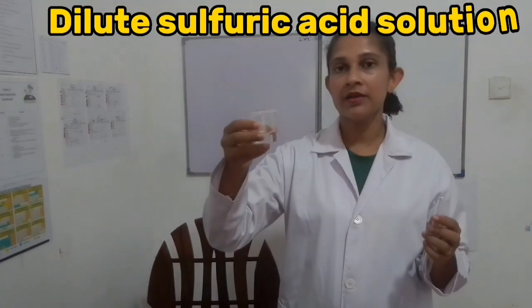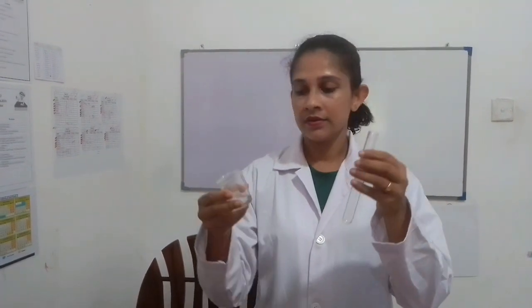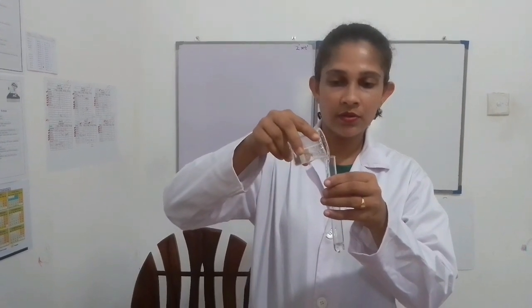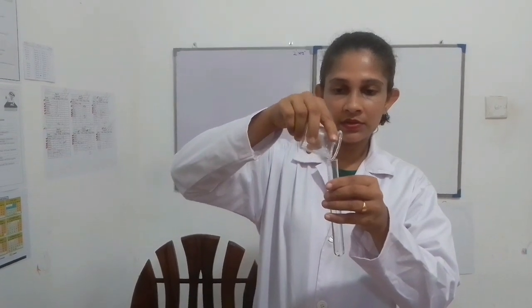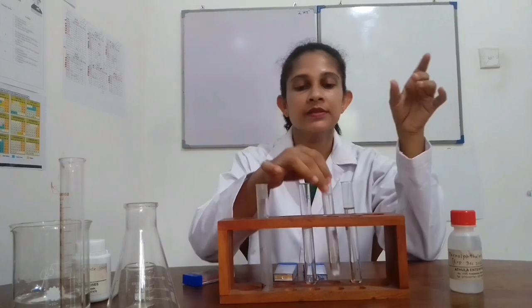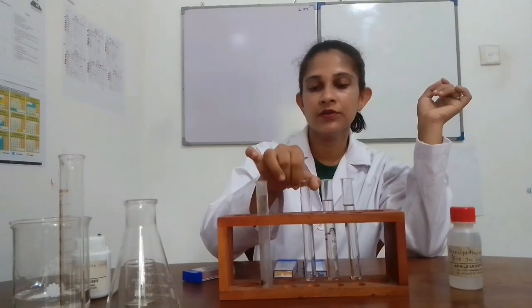This is dilute sulfuric acid, prepared by diluting concentrated sulfuric acid. I pour that solution into this labeled test tube. We have to use this solution carefully since it is an acid. Now I have prepared the solutions of sodium hydroxide, sodium chloride and dilute sulfuric acid.